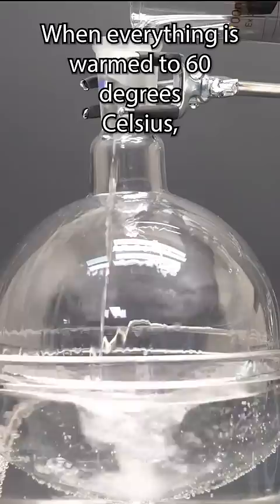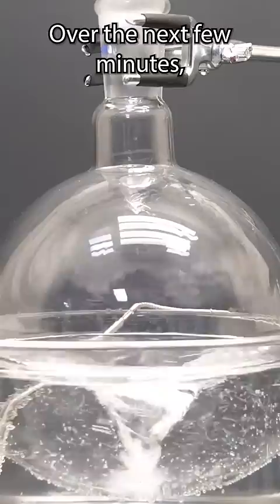To do that, I set up a flask in a water bath and add alcohol, water, and a silica precursor called TEOS. When everything is warm to 60 degrees Celsius, I add ammonia as a catalyst.